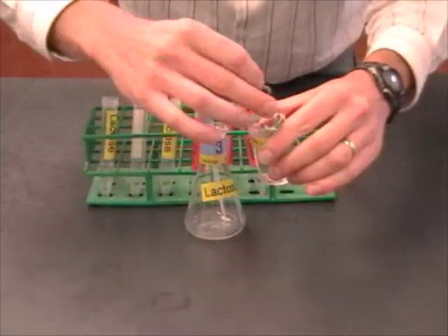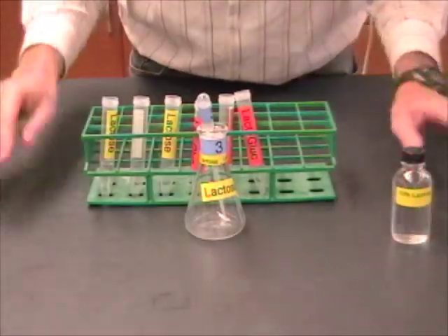And then I'm going to wait on that because everybody has to be ready to go before you add the sugars.